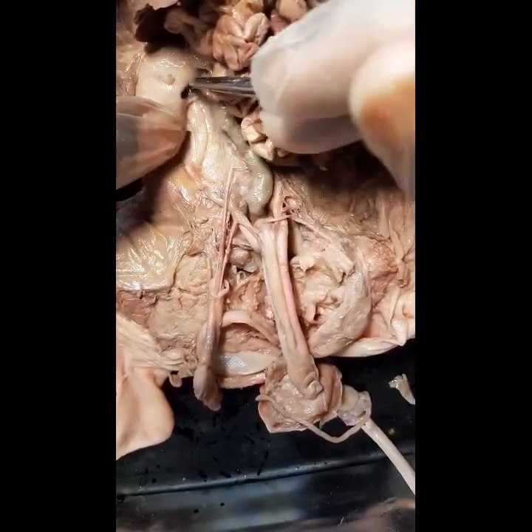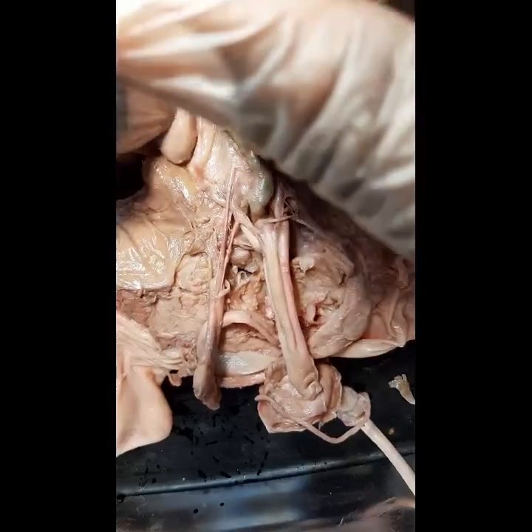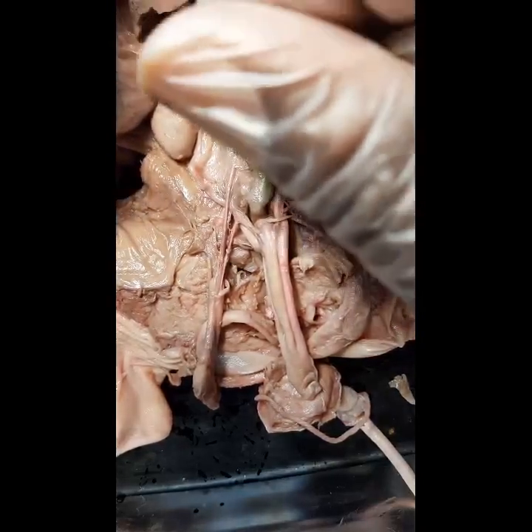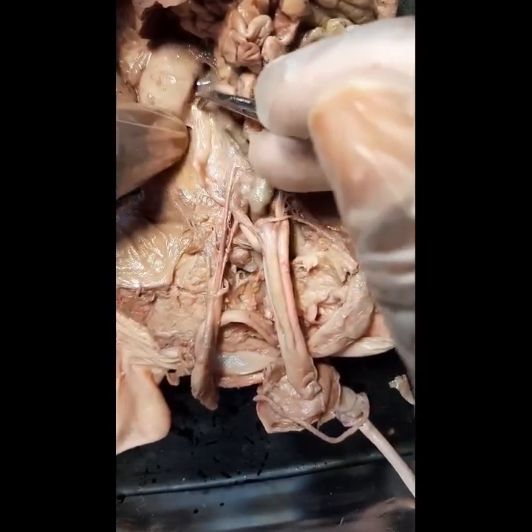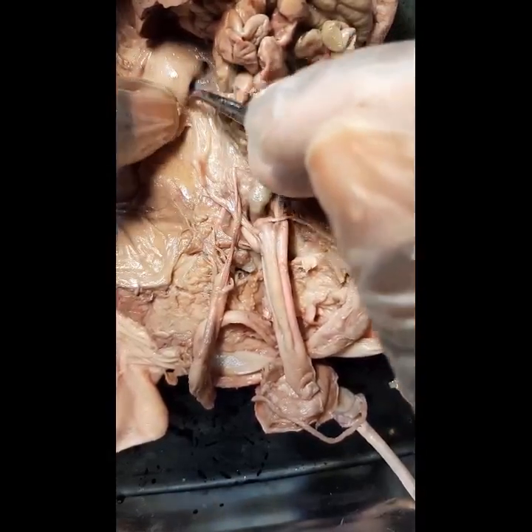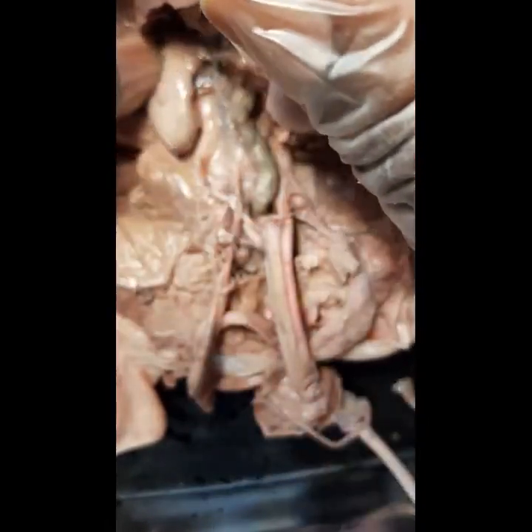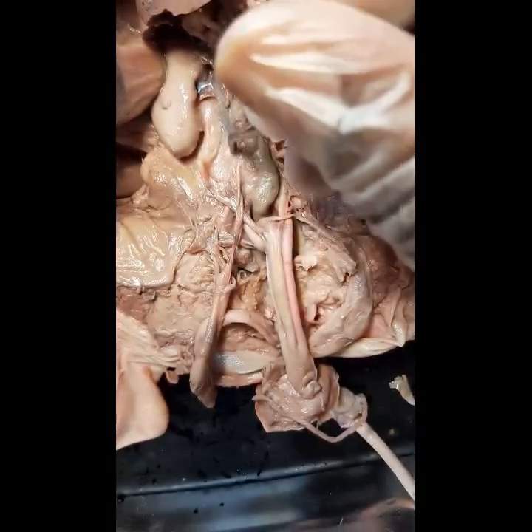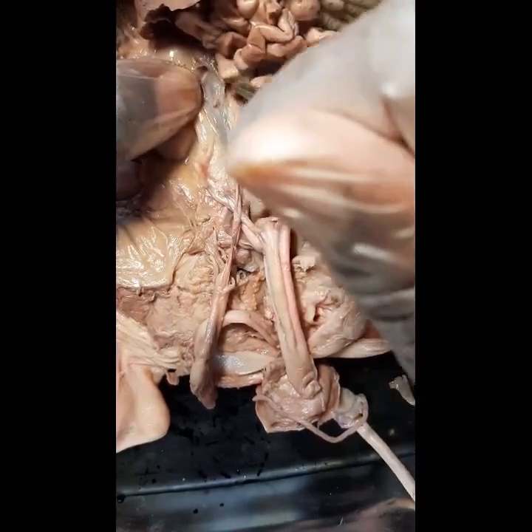We get to see the hilum. This indentation here is the hilum, and the hilum is where blood vessels exit and enter, nerves enter and exit — pretty much everything that connects to the kidney. Here you can see the blue is the renal vein and red would be the renal artery. The renal vein delivers blood to the inferior vena cava, and the renal artery gets blood from the abdominal aorta.